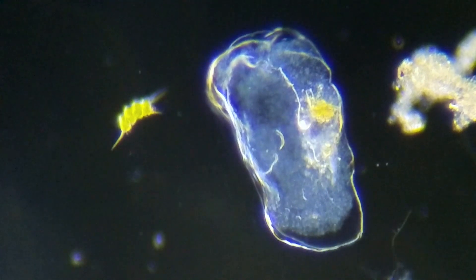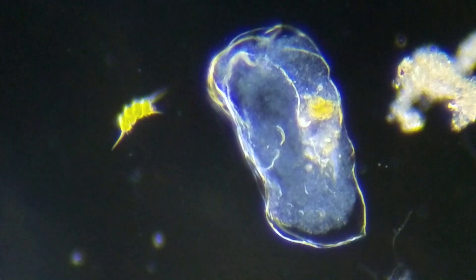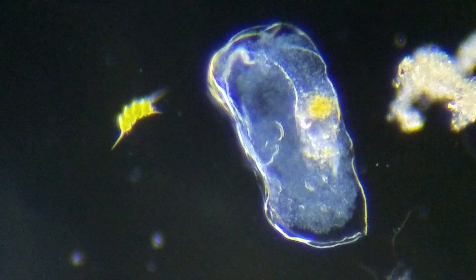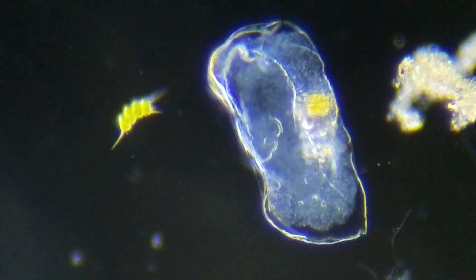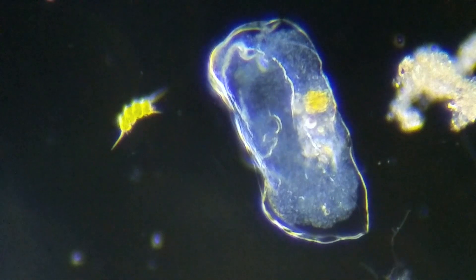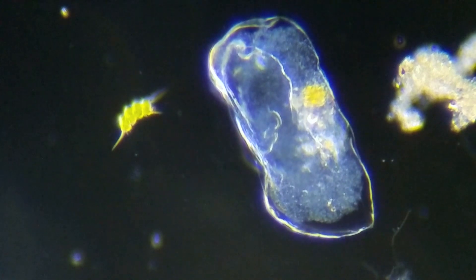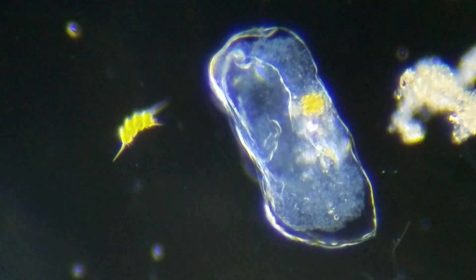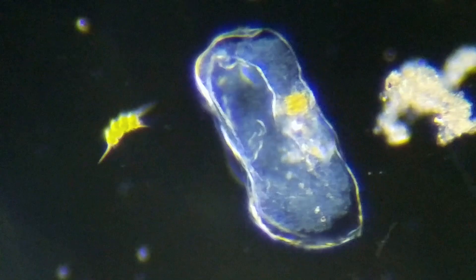An amoeba is a single cell organism — it has all the parts of a single cell and it's very interesting. It takes on all types of shapes in weird ways; again it's kind of like something that's being spilled, it can go in any direction, and that's one of the things I really like about it.